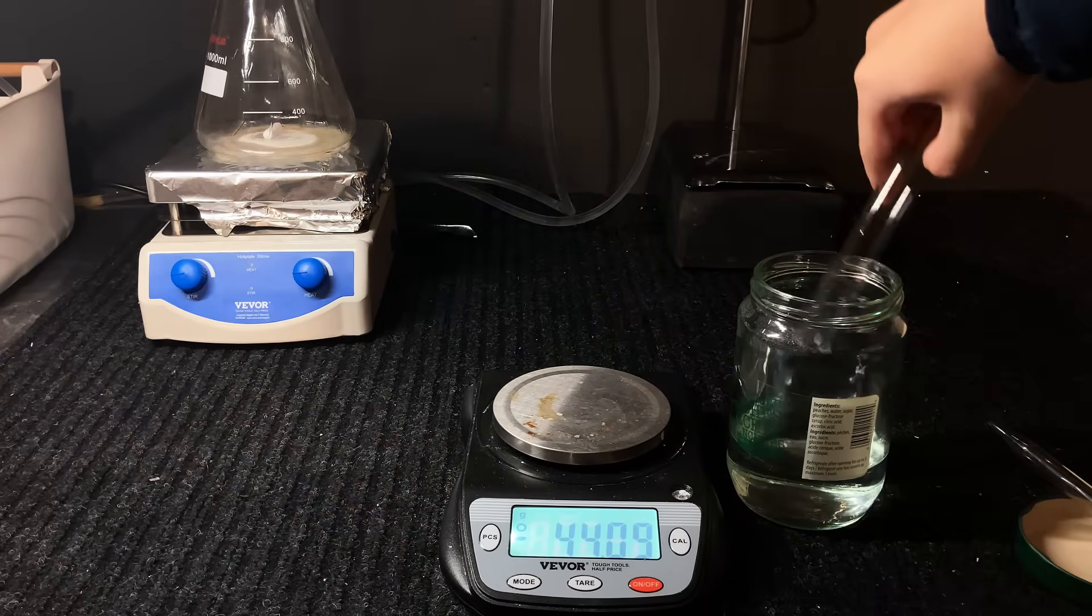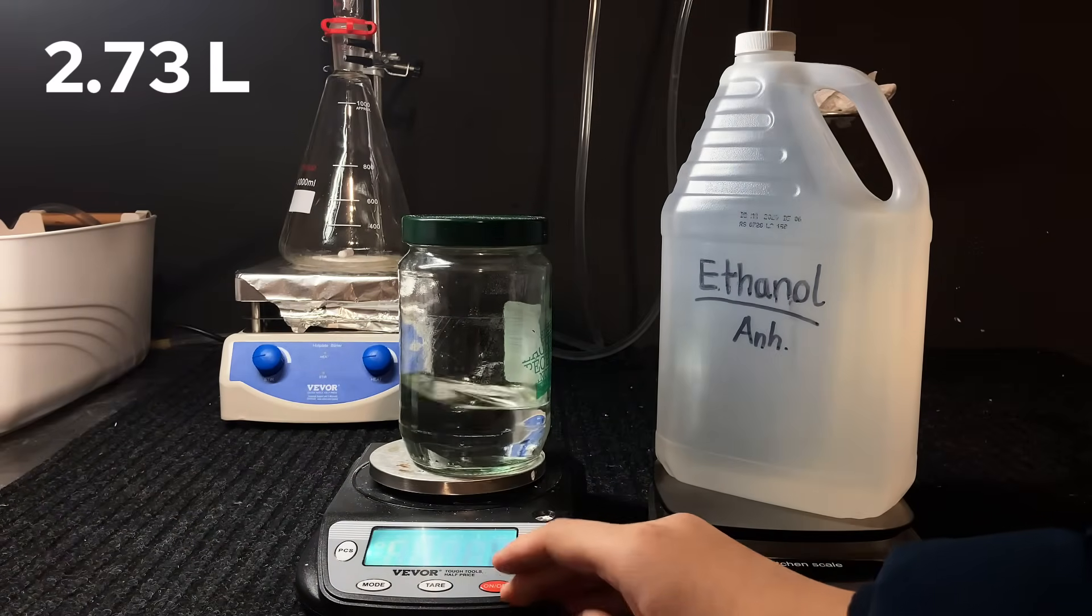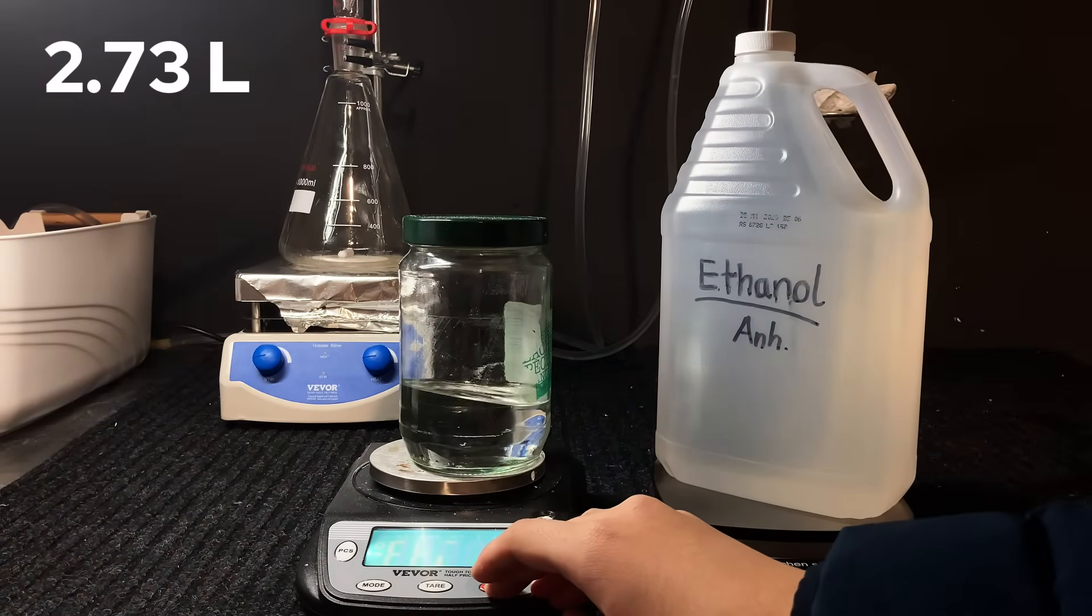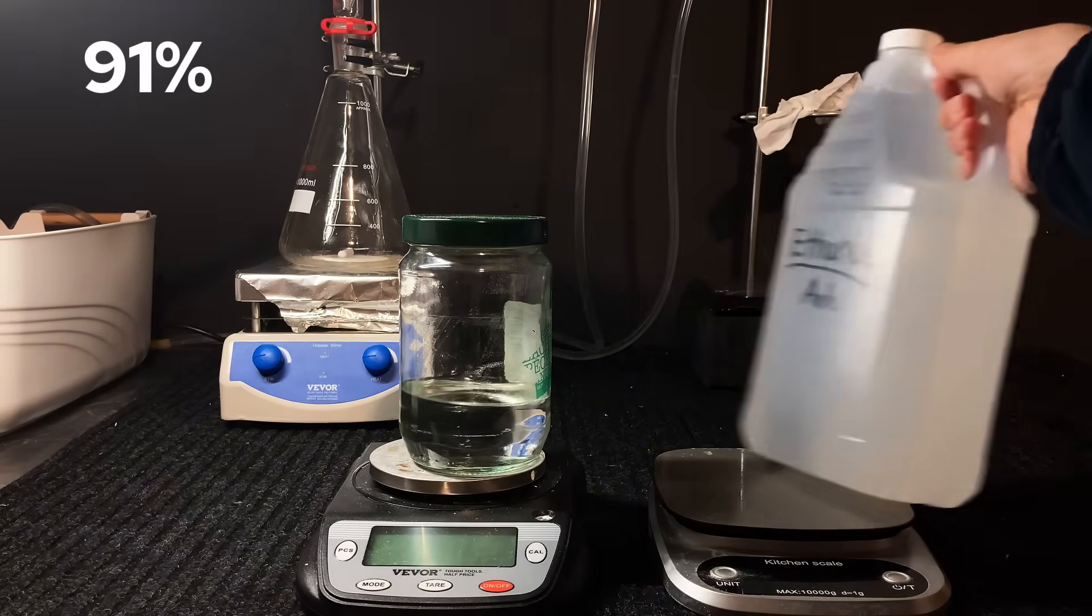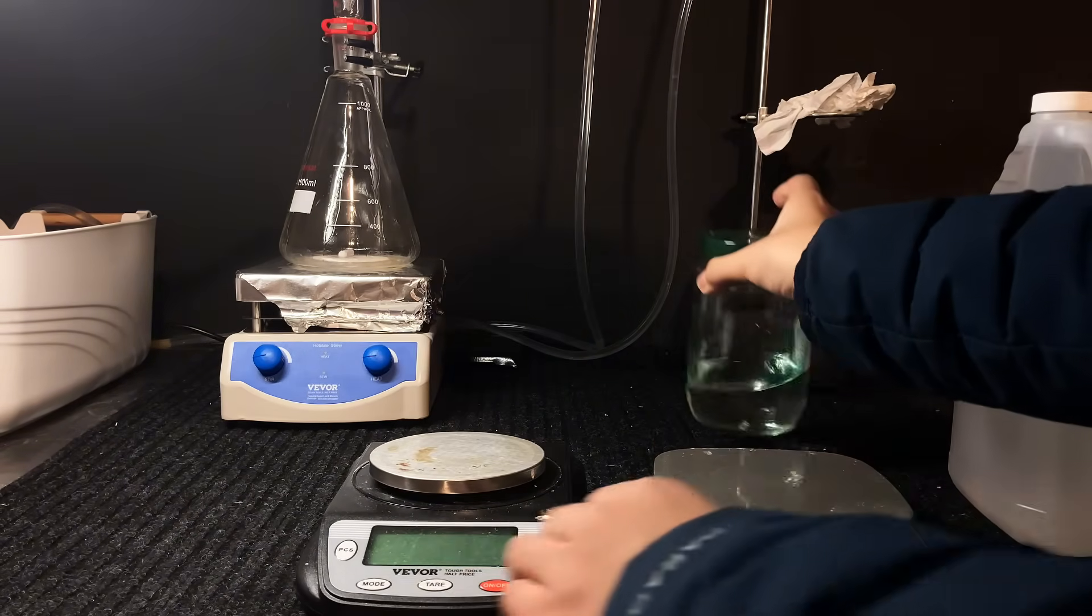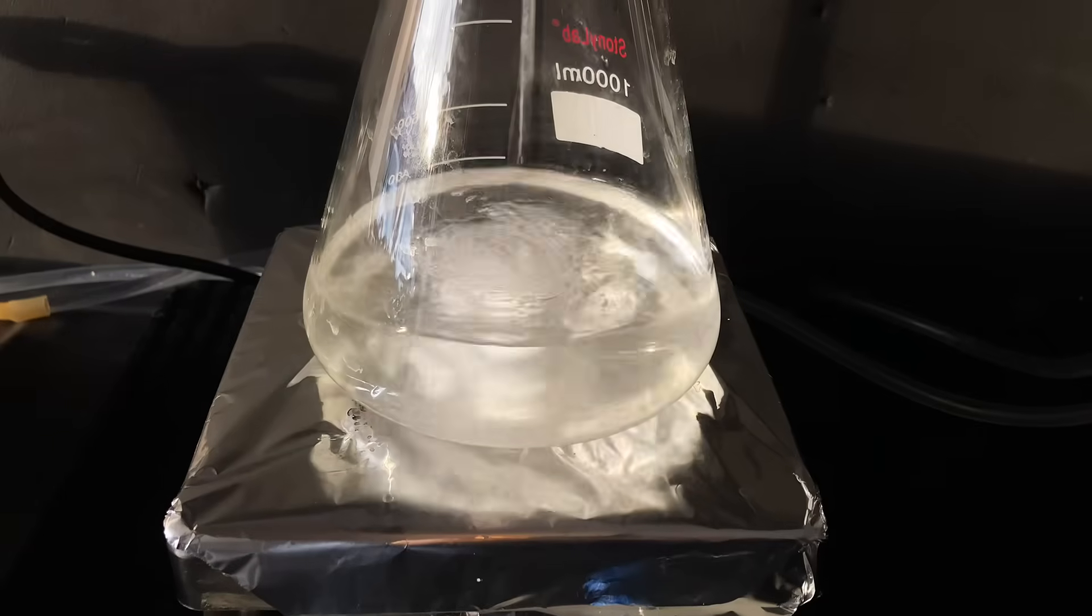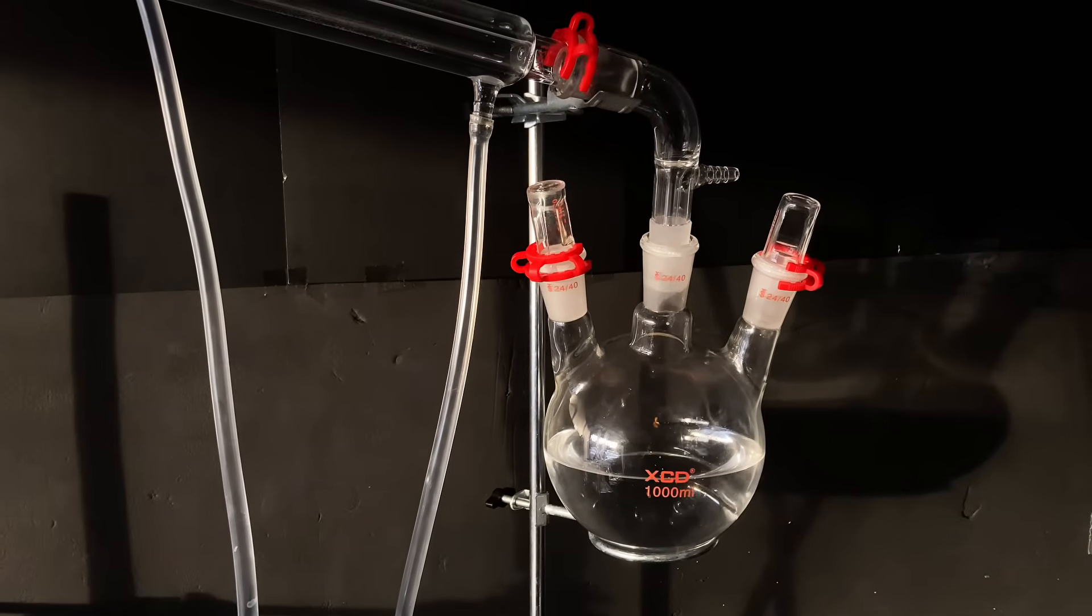Thus, calculating the volume I obtained, in the end it turned out to be around 2.73L, which is a percent yield of 91%. Not bad, but it could have been a little better if I had maybe stopped the first few distillations a little later. Indeed, for this project, I kept the distillations quite strict to ensure high purity.